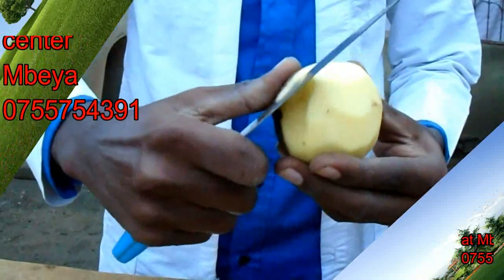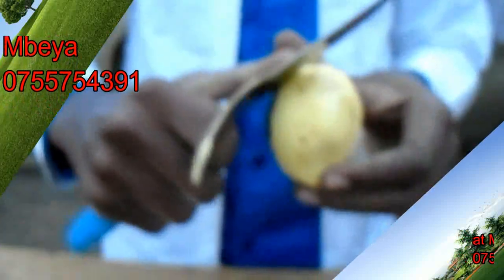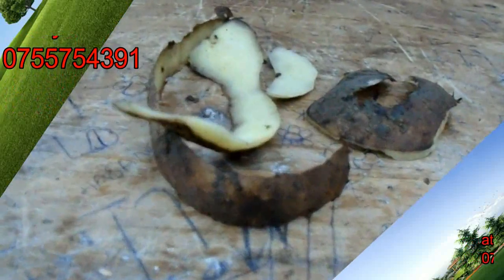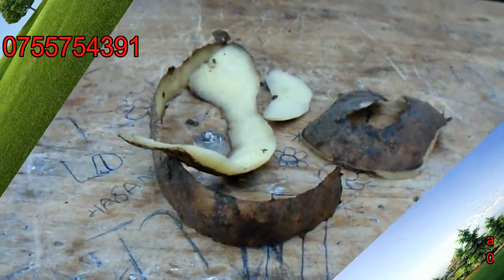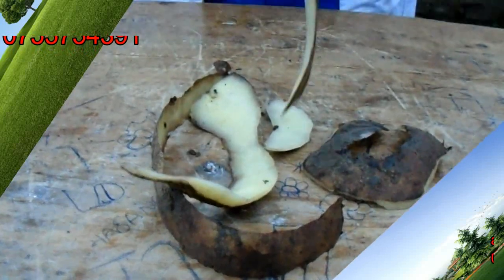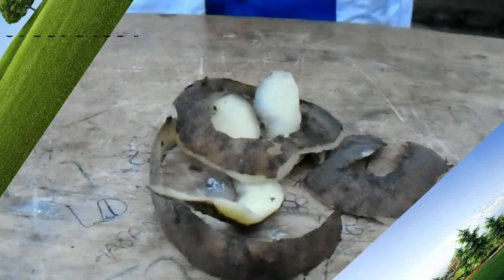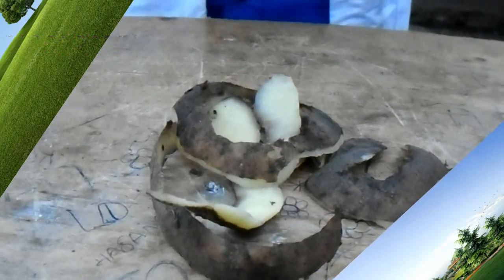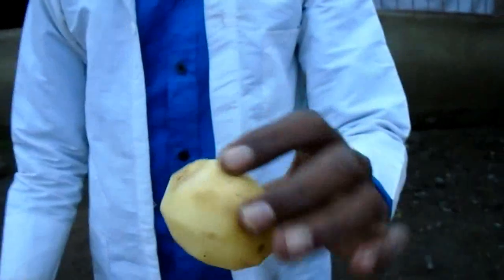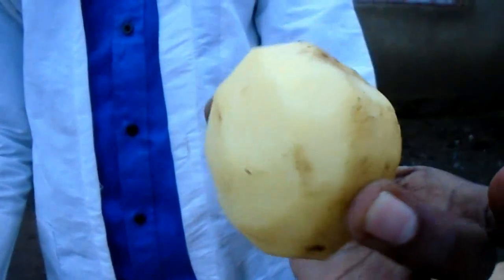I'm just peeling off like this. I have already done the first step, which is peeling off the Irish potato. I've just removed the outer part of this Irish potato.